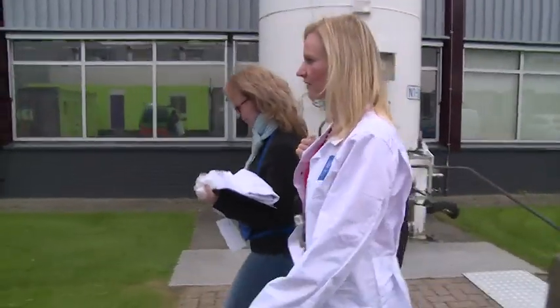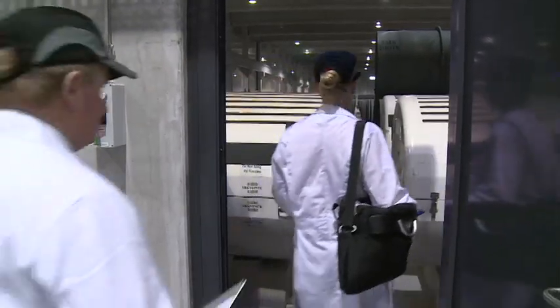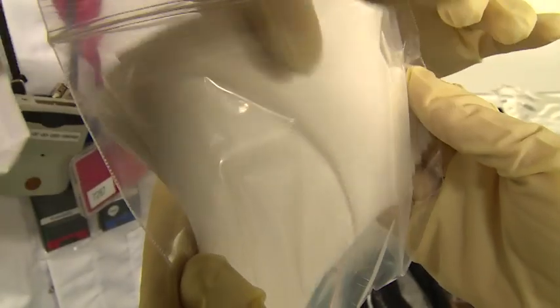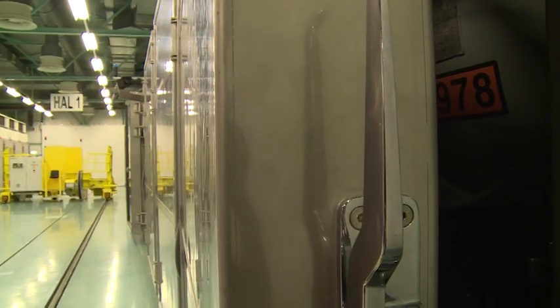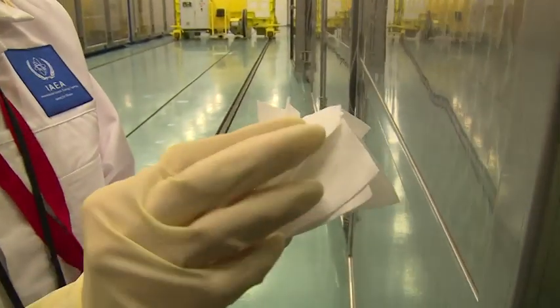The sampling kits that the inspectors take along into the field for environmental samplings contain these 10 by 10 centimeter cotton swipes. In general, there are six of these swipes in a sampling kit, so the inspector takes six of these cotton swipes at one area as replicates.